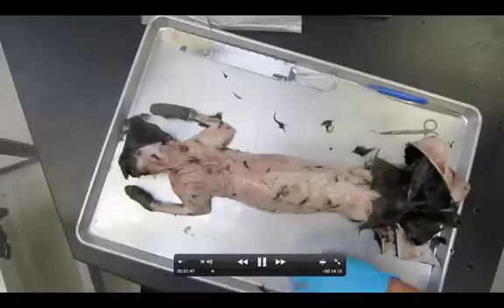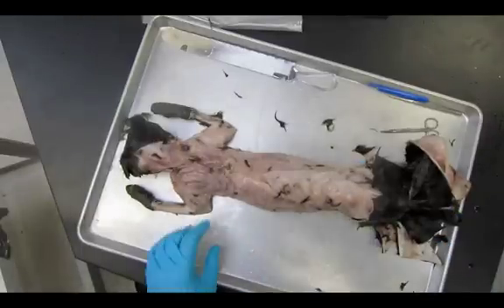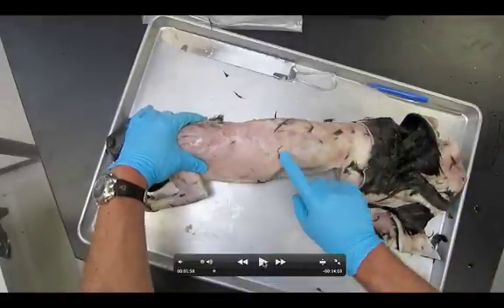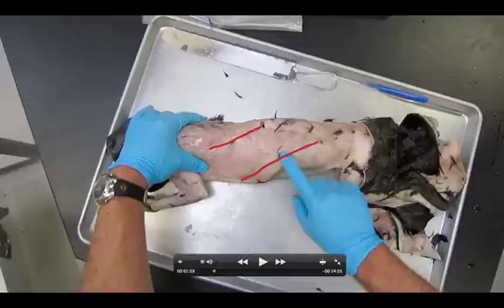Here we go for a second video. This is going to be a video showing the first dissection you guys are going to be making. I'm hoping that our computer here will be able to process the video and recording. It looks pretty choppy still. First thing I want you guys to notice: you're going to see a line going along the side of the cat, another line right here, and another line right here. What you're seeing here are three muscles that we're going to be getting underneath and dissecting. Let's hit play on the video.